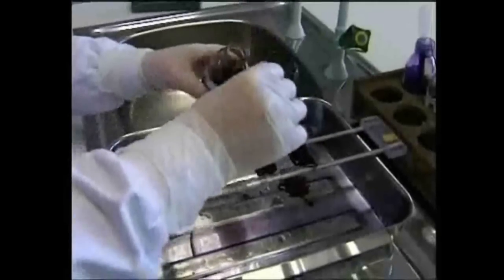The next step is to counter-stain the smear by covering it with safranin solution for 30 seconds, and then rinsing it with tap water. Gram-negative cells will be stained pinky-red by the safranin, but gram-positive cells will still be purple.